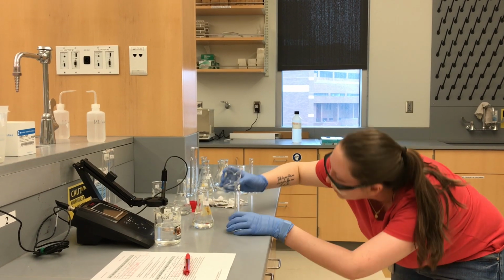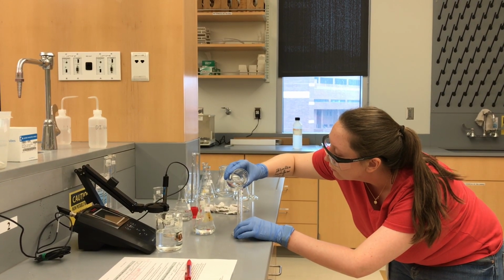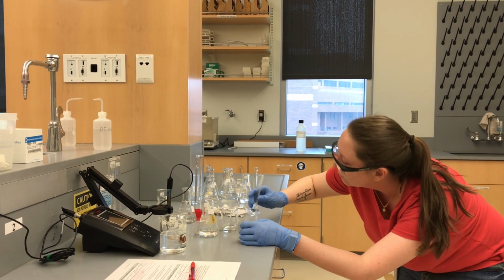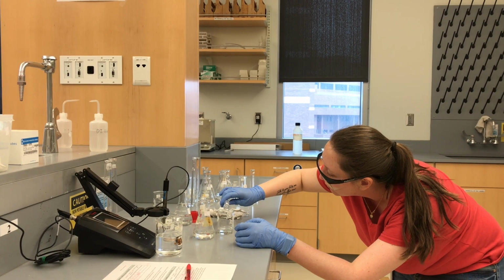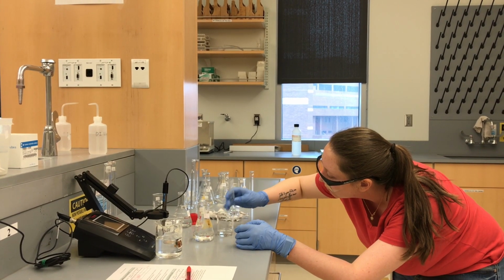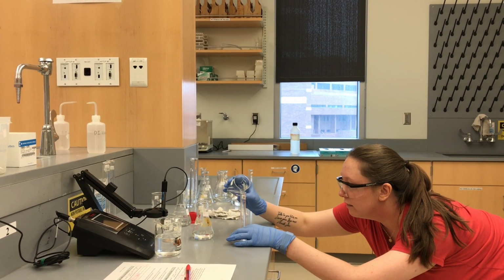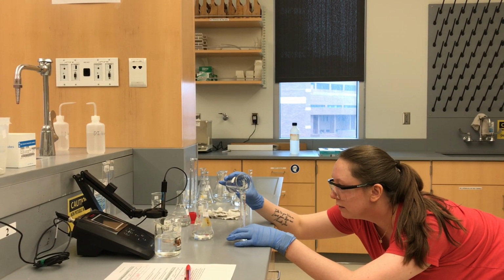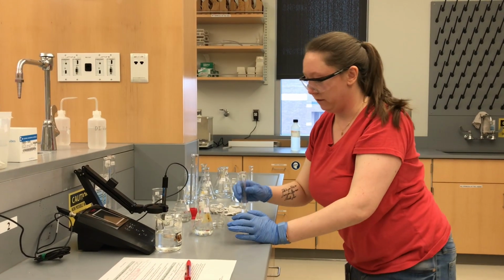Come on, HCl. Alright, HCl and I are in a fight. Alright, close enough.